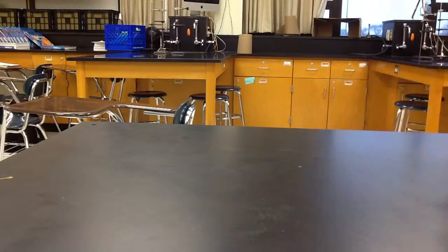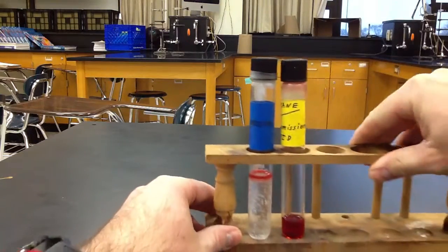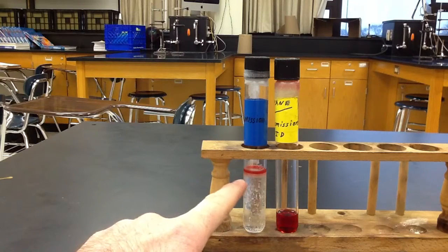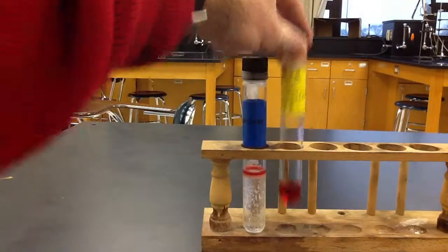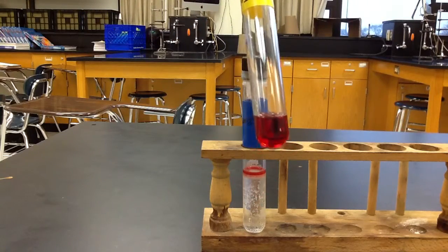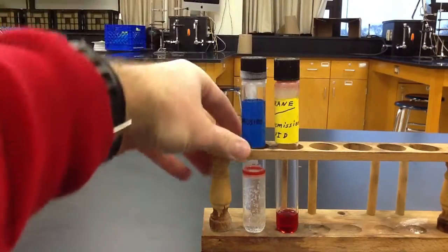All right. Our next one we're going to look at is transmission fluid. Transmission fluid is red in color, and we can see that in water, transmission fluid is insoluble. We see a layer of it. However, in hexane, it is all dissolved. We have a uniform color there. It's all dissolved in hexane.